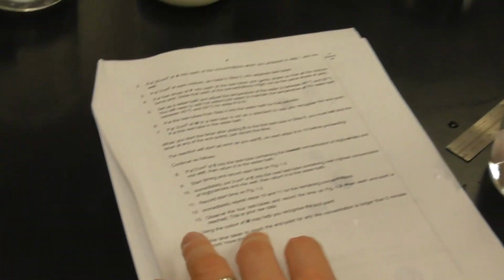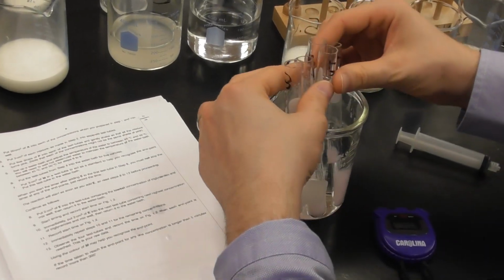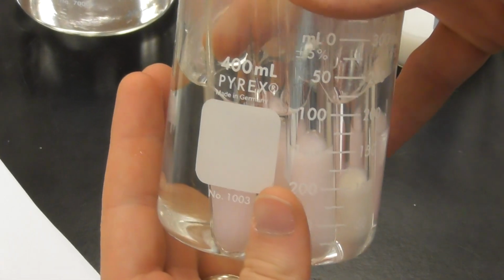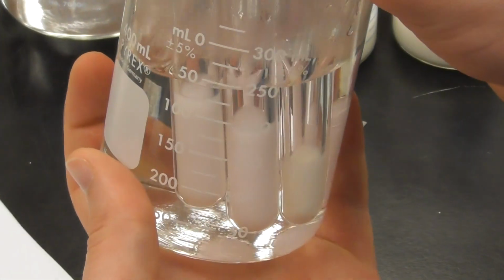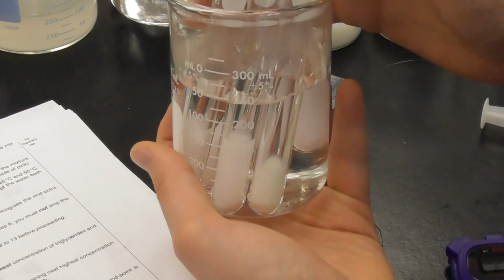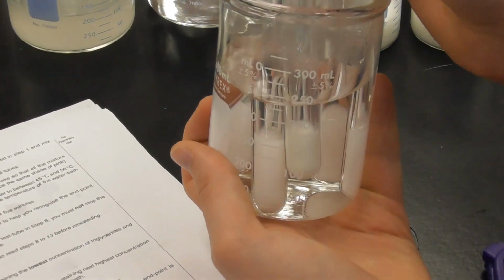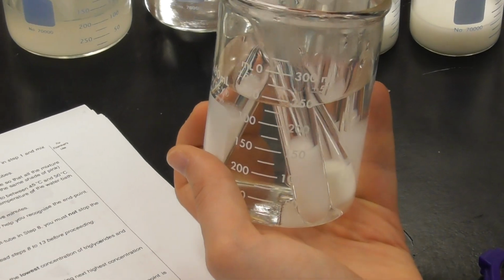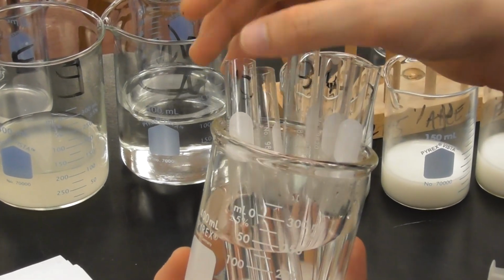All right. And make sure that gets shaken. Now, keep an eye on the difference in colors here. We're just going to keep an eye on the differences in colors here. Periodically noting the differences in colors, remembering that that is our endpoint. So just keep an eye. That is 5, 4, that was, oops, 2, 3. All right, 5.